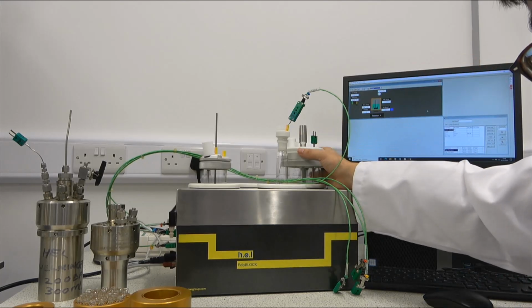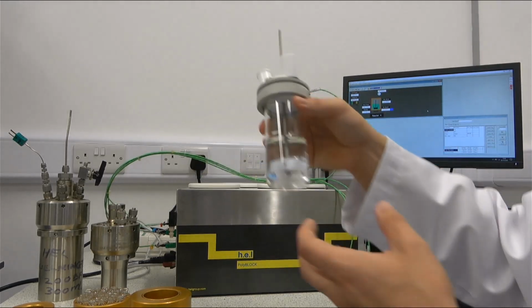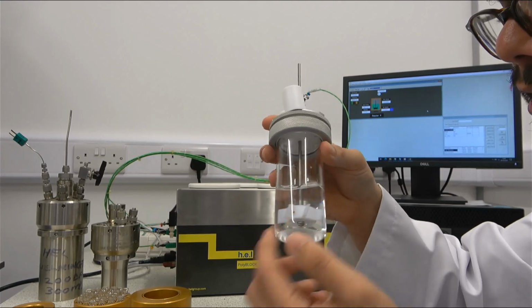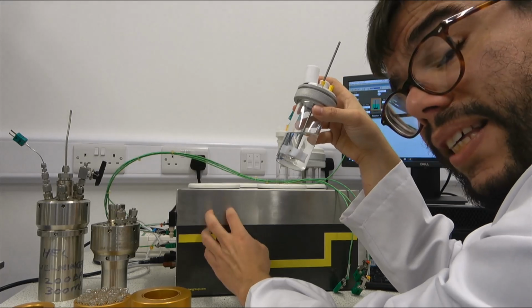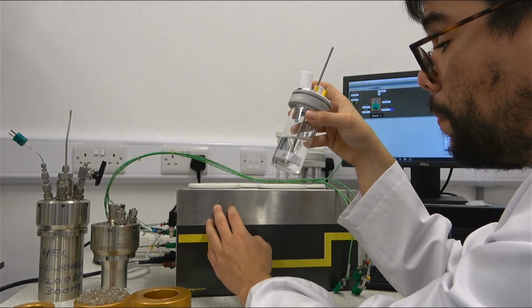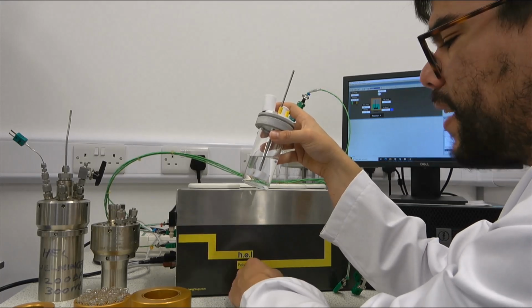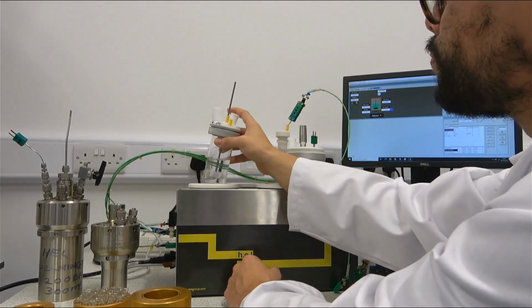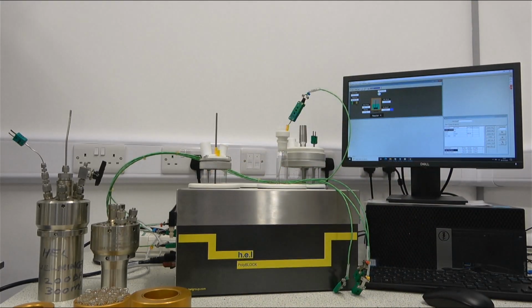As I mentioned, this one had a direct agitation, but in this case, we have a magnetic agitation. We can see when we connect a magnet that is inside of the PolyBLOCK, it'll ensure that there is a complete agitation inside of the vessel. But also, one of the biggest fears that we can have with magnetic agitation is that in certain cases, there might be a case of decoupling.